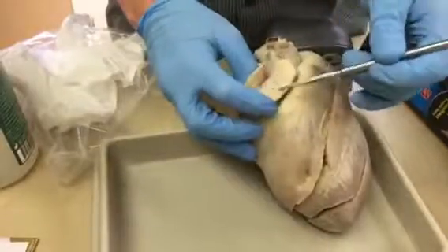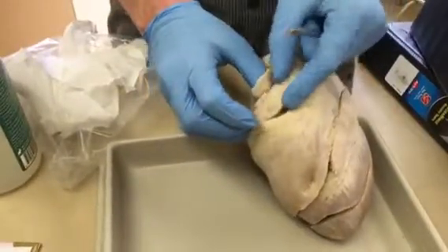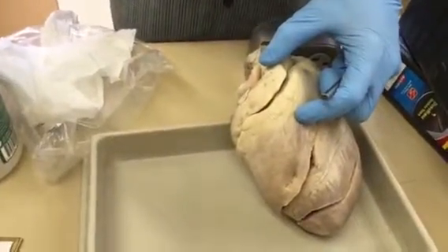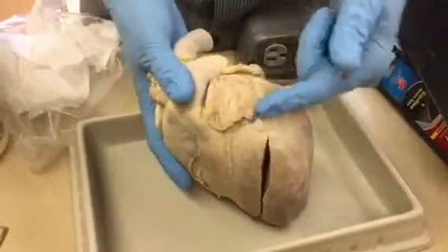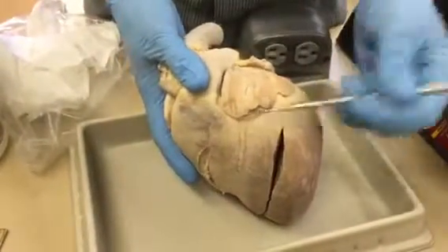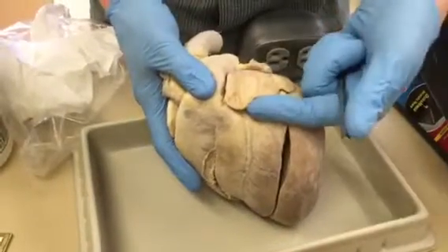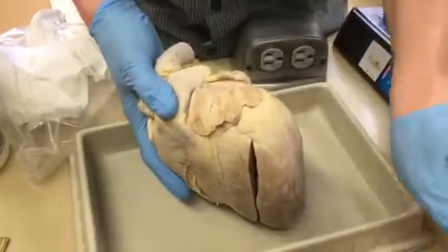But if I asked what the structure is, pointing to this, the auricle is the actual flaps, and they allow the atria to take in a little more volume. They kind of stretch. They look like pig's ears, which is why they're called auricles, because it sounds like aural. They look kind of like a folded over ear of an animal. I skipped ahead, but that's there.